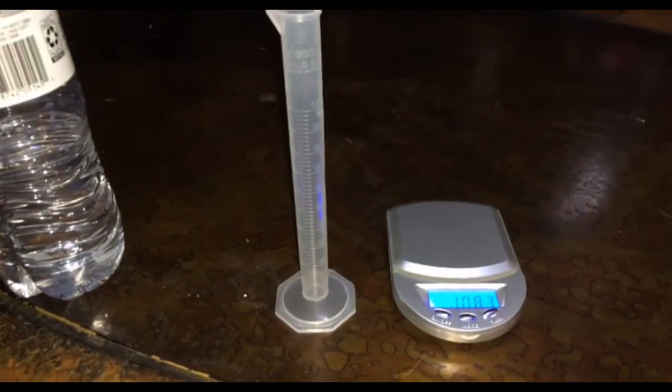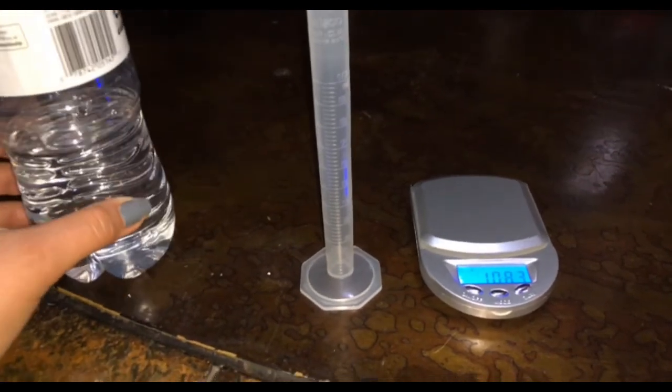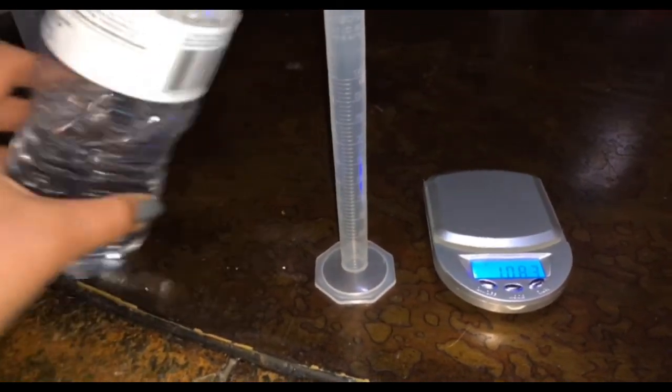The next step is taking the graduated cylinder off and measuring approximately 7 milliliters of water in the 10 milliliter cylinder. The next step would be finding the high volume, and the high volume is at the highest point of your measurement. As you can see here, it's not exactly on 7, so my high volume is at 7.2. After that, you will have to find the low volume, which is at the lowest point of your measurement. It usually is pretty similar to your high volume, and my specific low volume is 7.1.